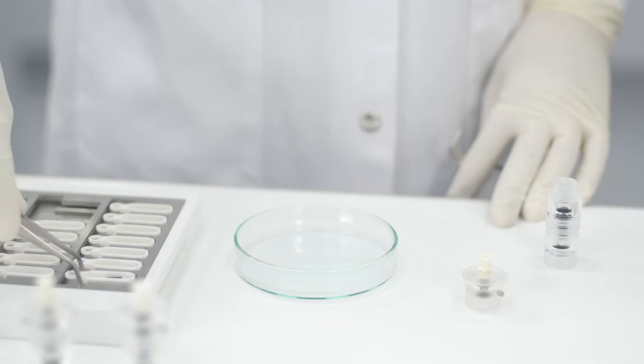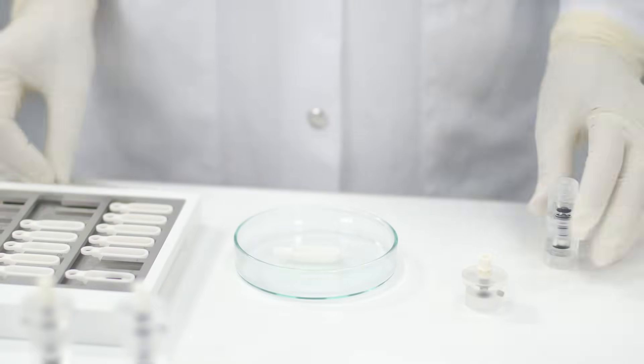Place the ceramic boats onto the sample rack. We recommend a separate boat for each column.